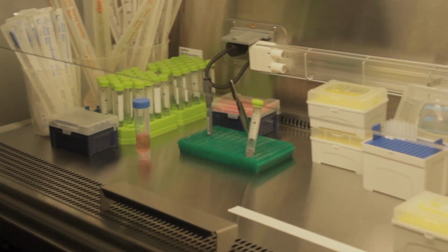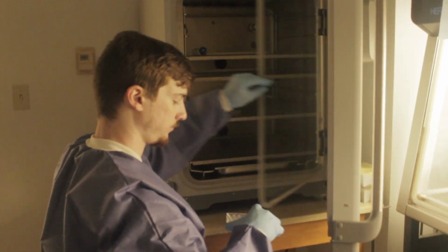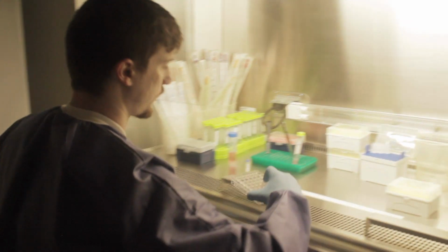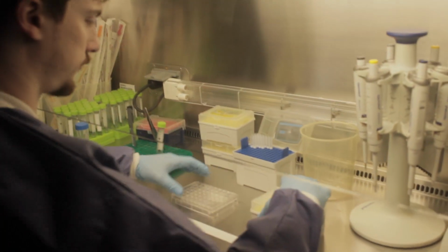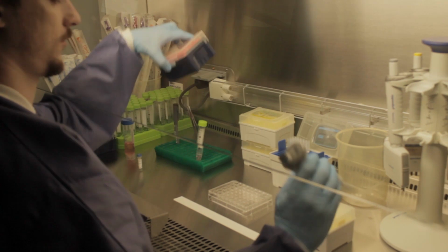In this cutting-edge cell room, our research focuses on how altered amyloid protein aggregation impacts mammalian neuron toxicity. We conduct tests on cell death, mitochondrial stress, and reactive oxygen species to see how these protein aggregates impact cells when aggregating in the presence of different lipids.